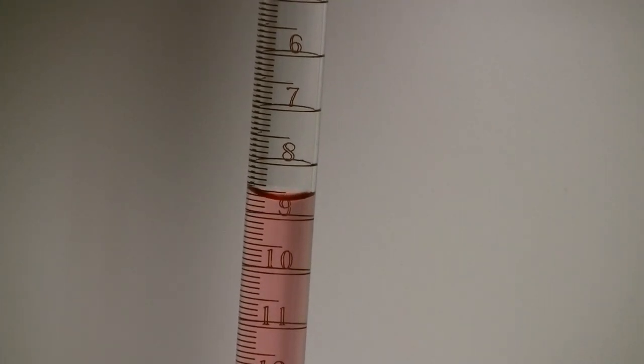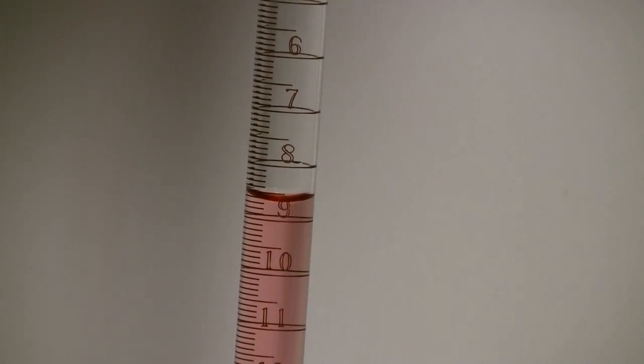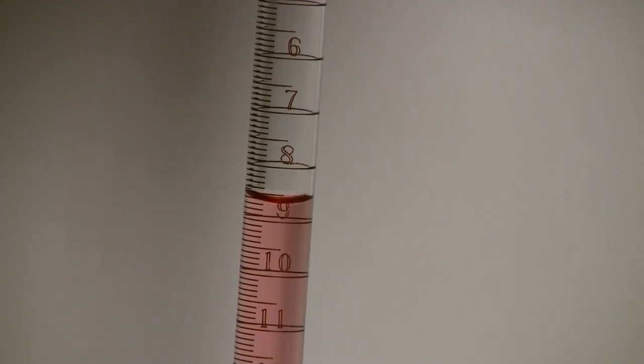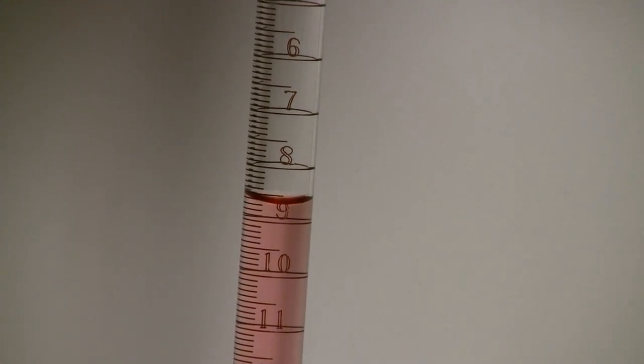Record this final volume to the hundredths place. The volume dispensed will be calculated by difference. The final volume minus the initial volume equals the volume dispensed.